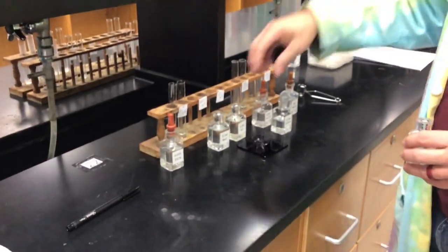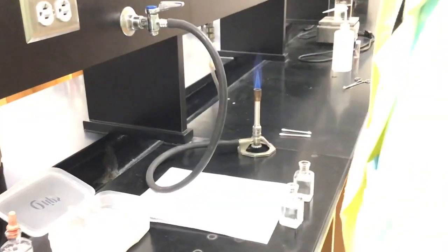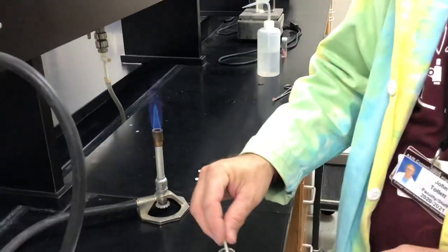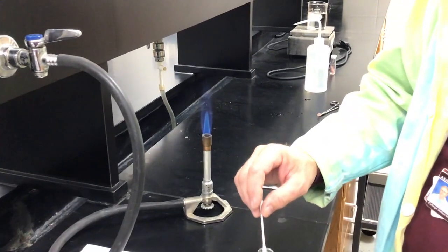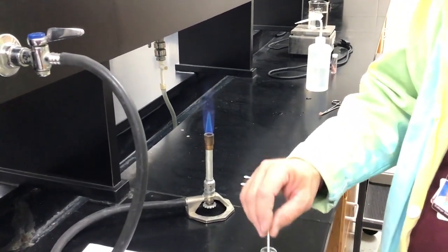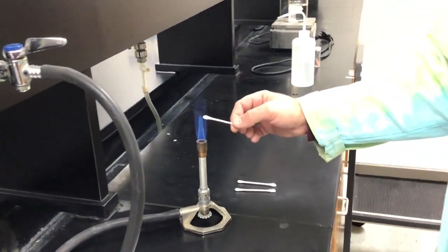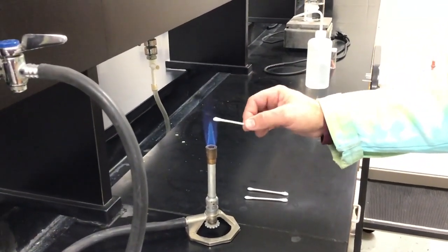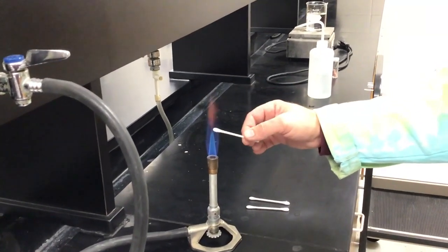We'll do the same with potassium chloride. We'll use a cobalt blue glass to look at our unknown and our potassium chloride and see if there's any difference. I'll put a Q-tip in the KCl, and then a Q-tip in my B3. I'll try the KCl first and see what that looks like. Come on, ion. There they go. I'm going to put it with the blue, with your cobalt blue glass overlay. There we go.